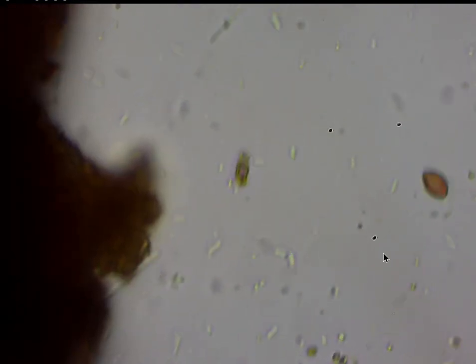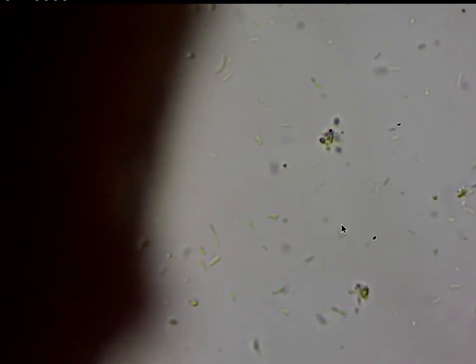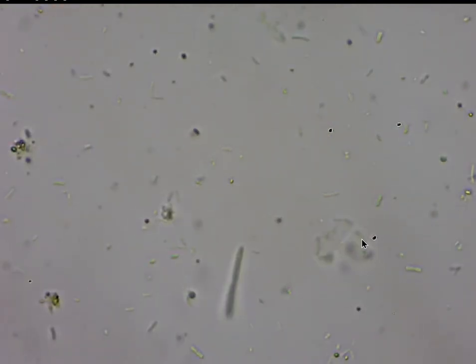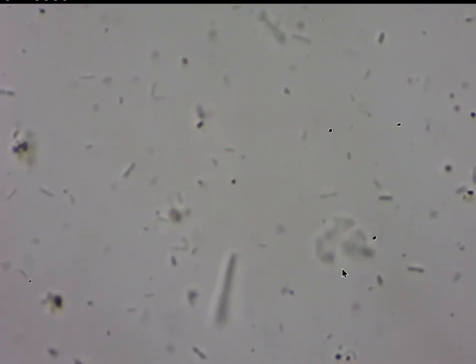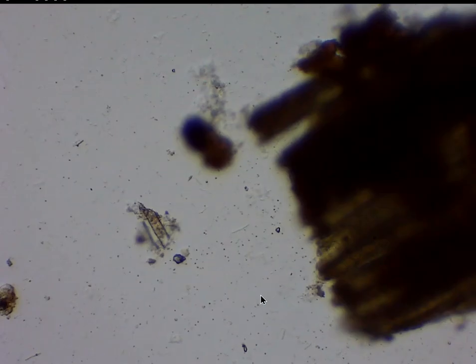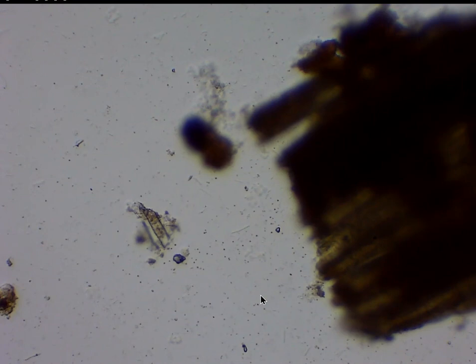There's another testate amoeba. Millions of them in one drop. Long rod shape. I don't know what these cloudy things are — I only see them in the tea. I always stop and look at them because they look so much like amoebas, naked amoebas.